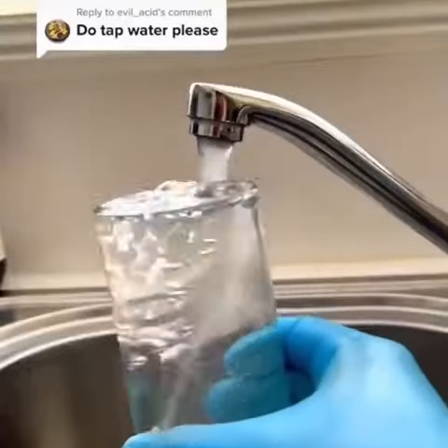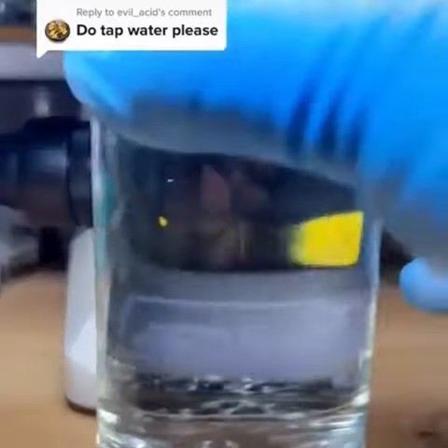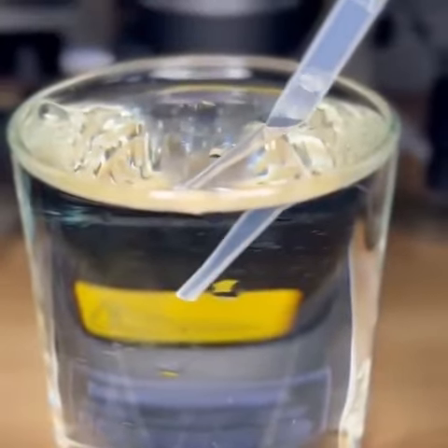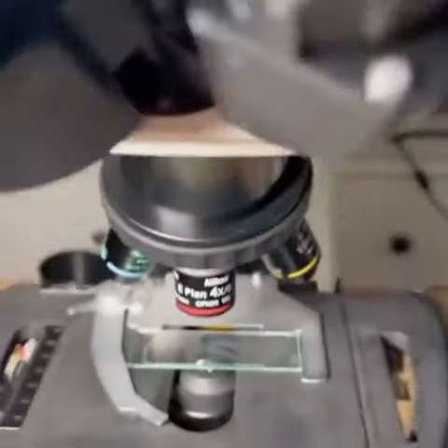Let's find out what's really living in tap water. I'm going to look at a drop of tap water under the microscope. Will there be microorganisms? Let's have a look.